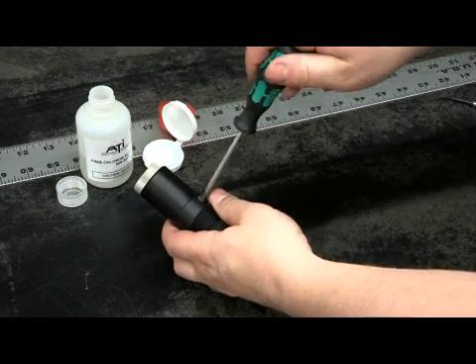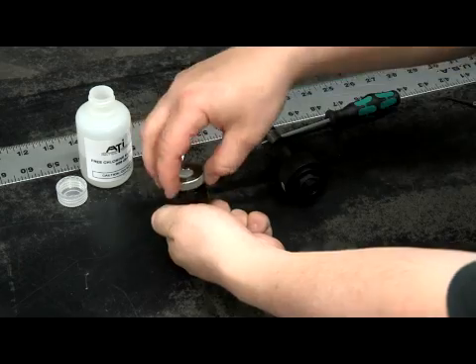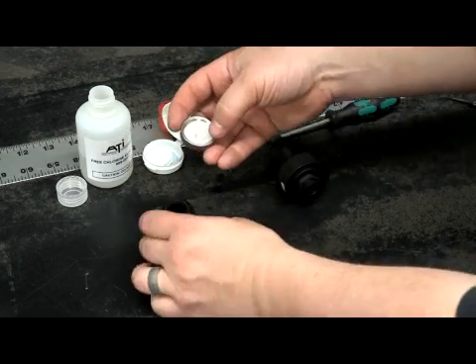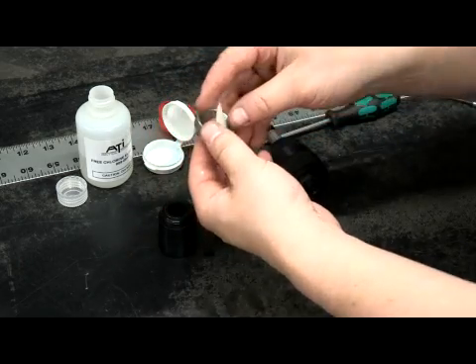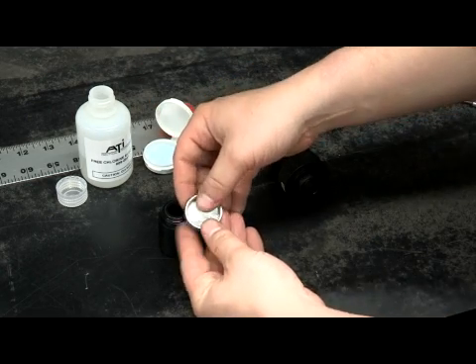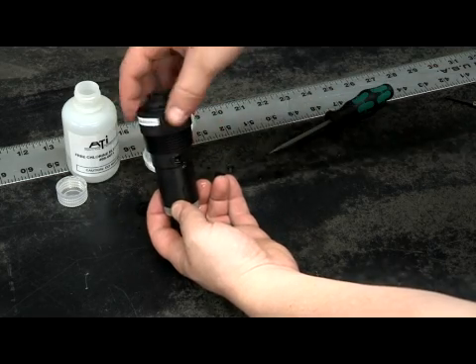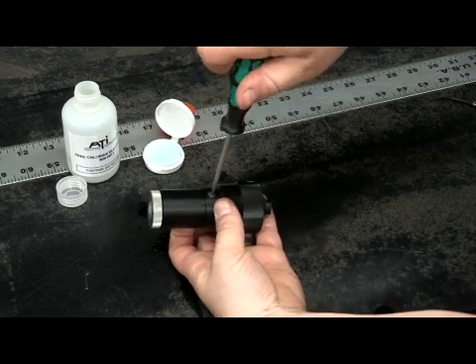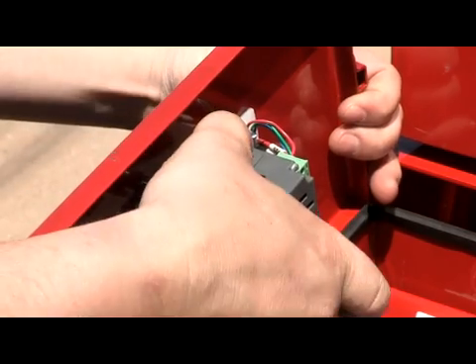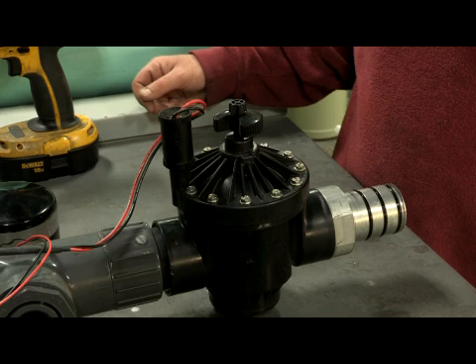Part of the routine maintenance for the i-Series is occasionally recalibrating the unit's analyzer about every two to three weeks on average, depending on water quality. Replacing the probe membrane and electrolyte about every three months on average, again depending on water quality. Cleaning the sampling valve screen filter as needed. Remove the micro SD card to mainly retrieve data and information from the site. Occasionally debris will get caught in the diaphragm inside the valve.